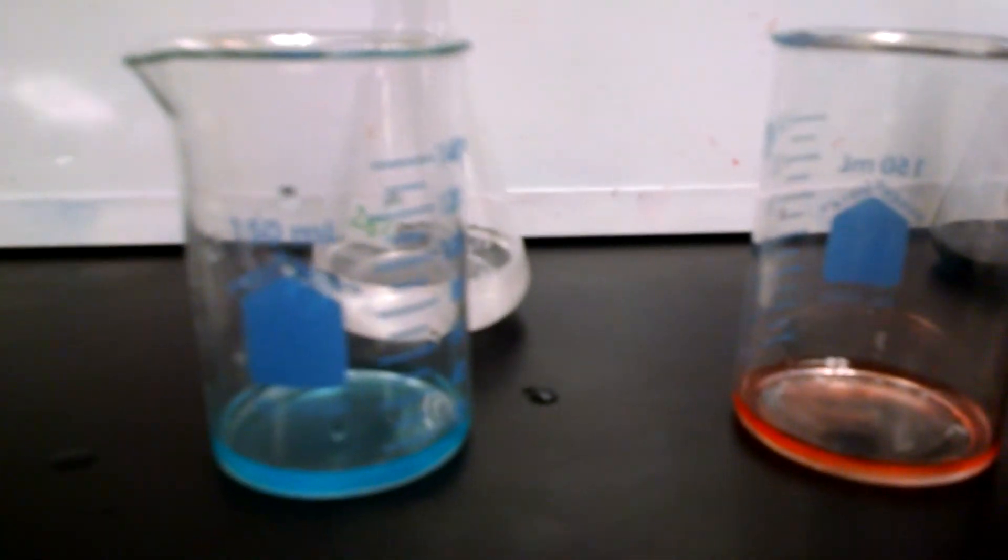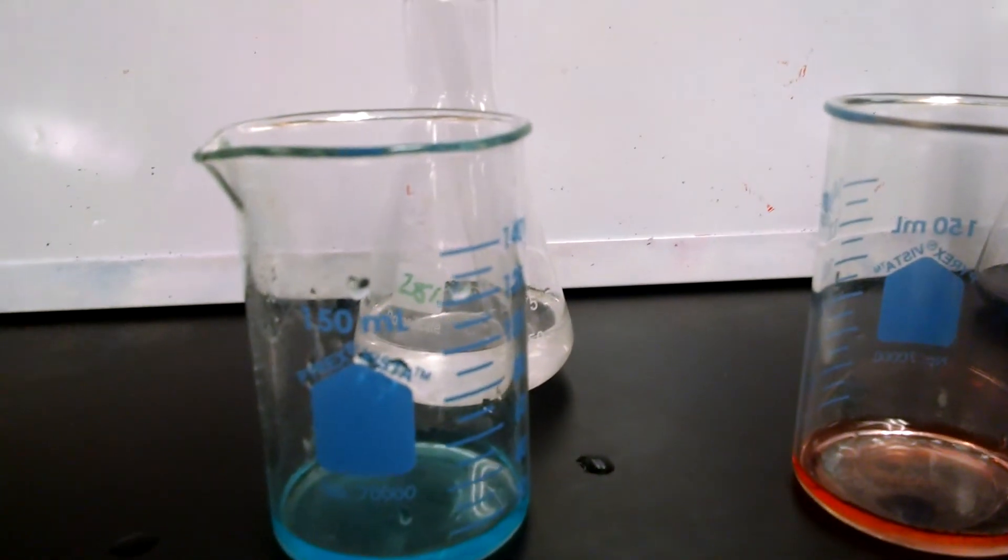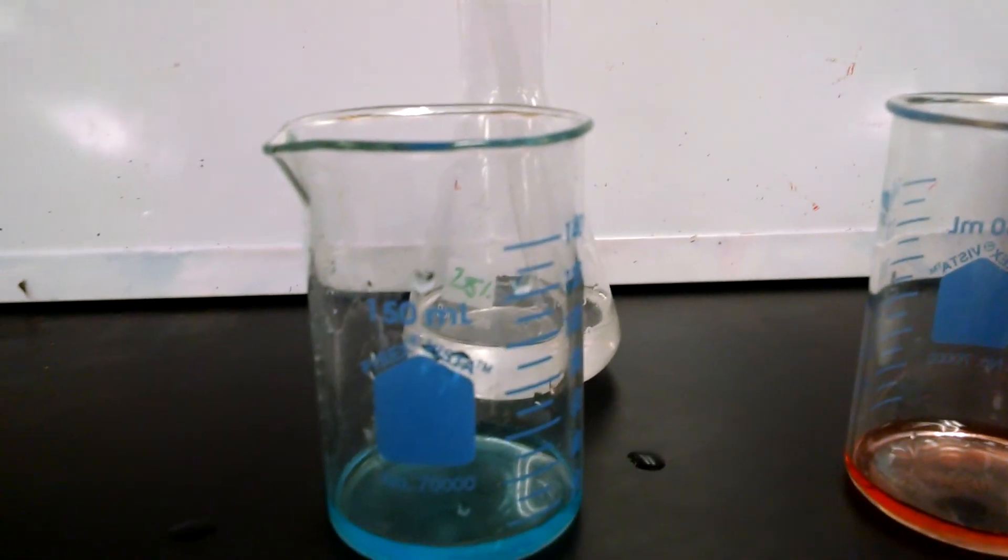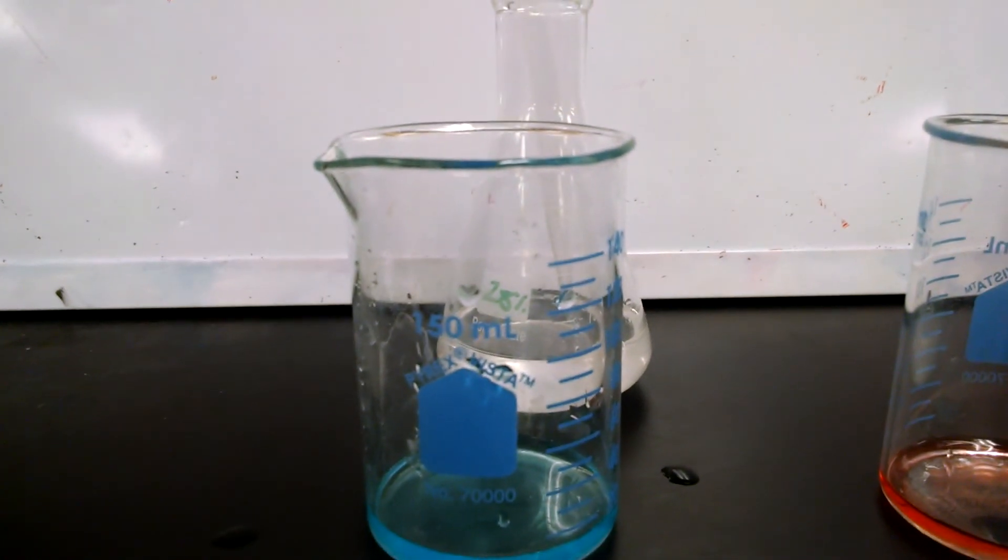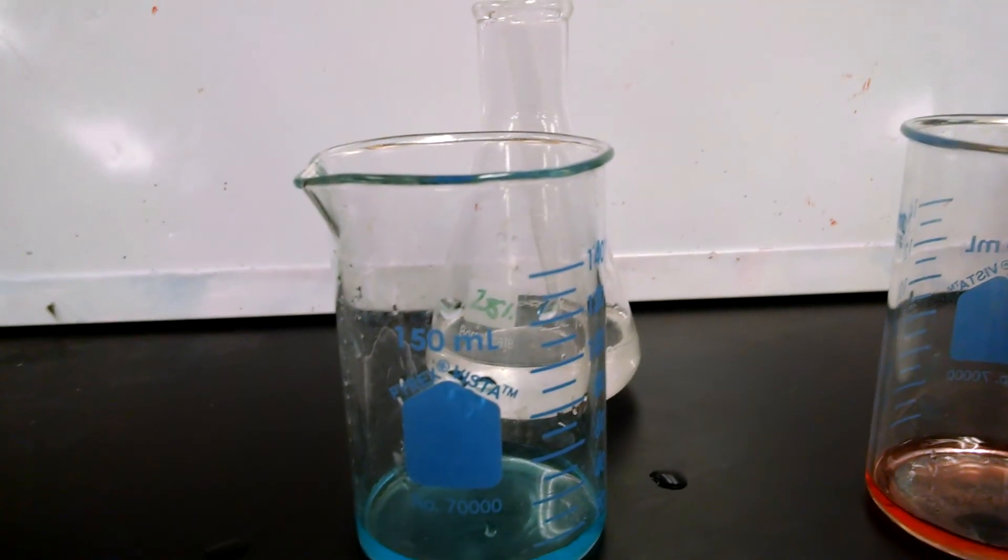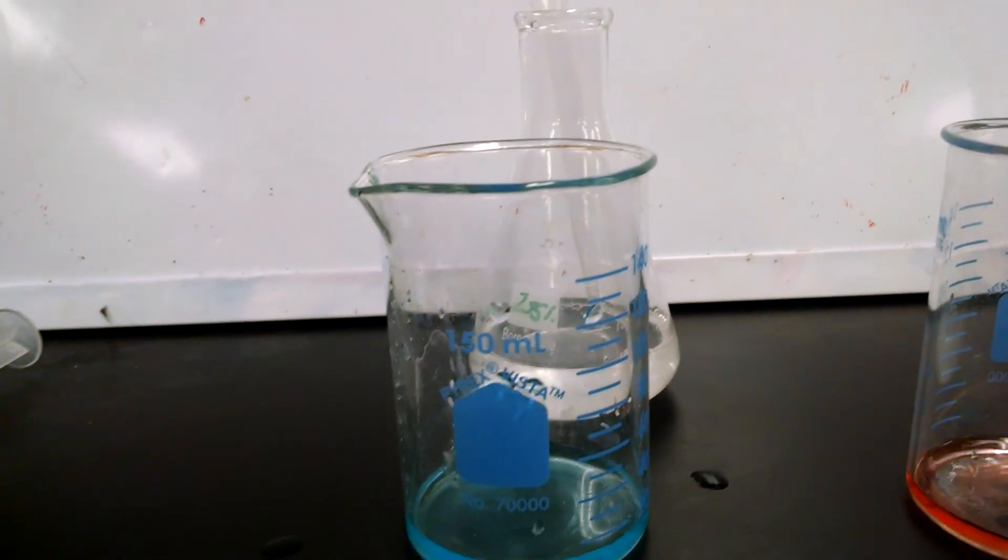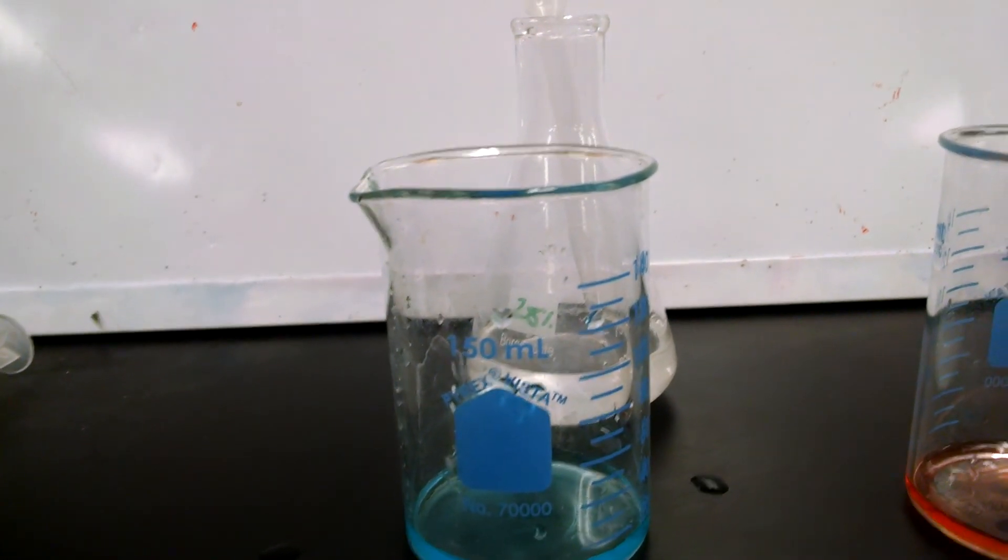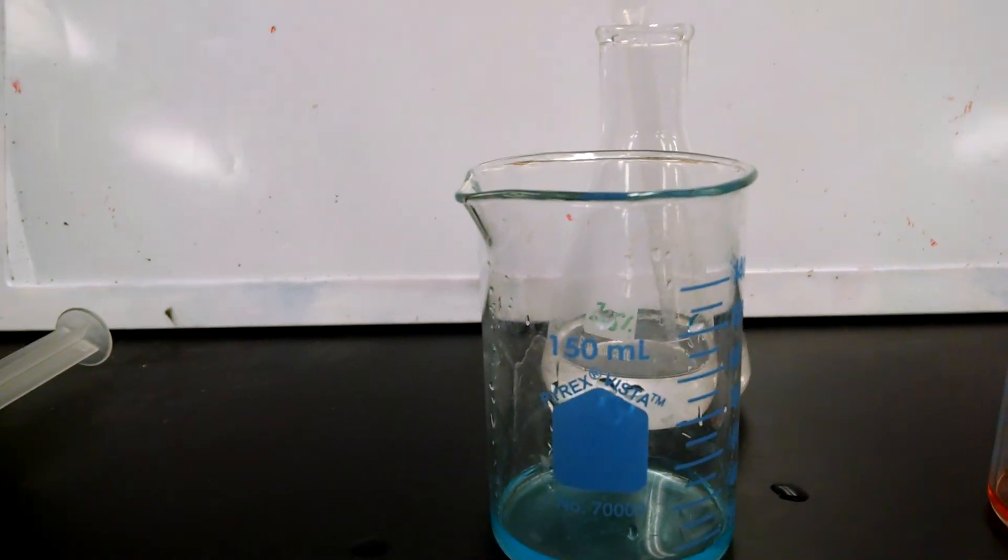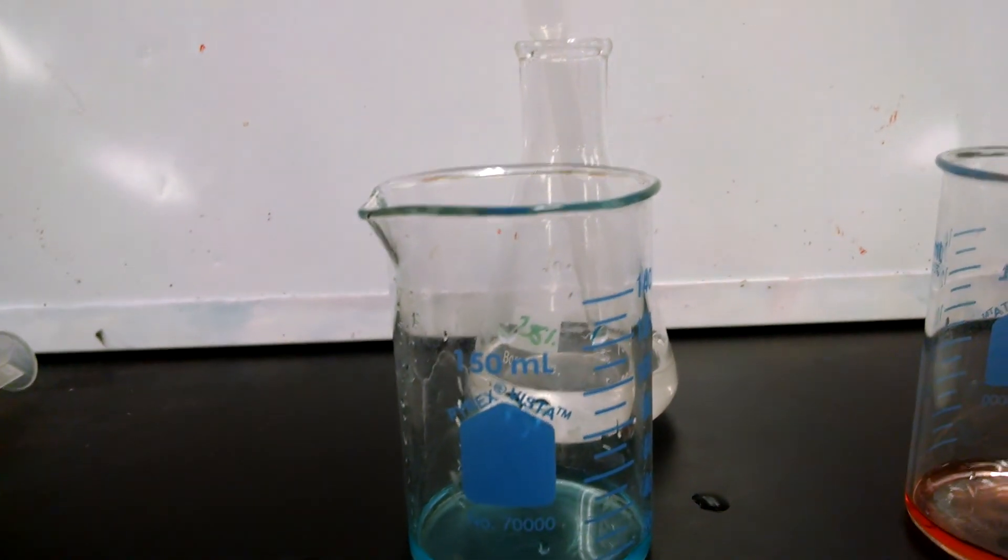Separated by hydrogen bonds. The purple color made of red and blue binds to the column by hydrogen bonds. The red comes off at 6% rubbing alcohol because the polarity is different than 28% rubbing alcohol. 28% is less polar.